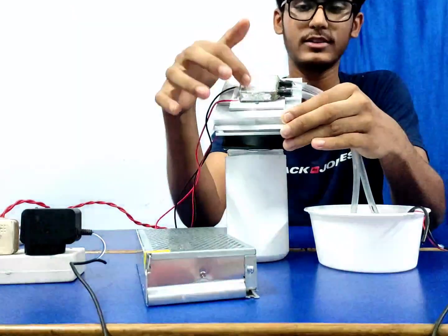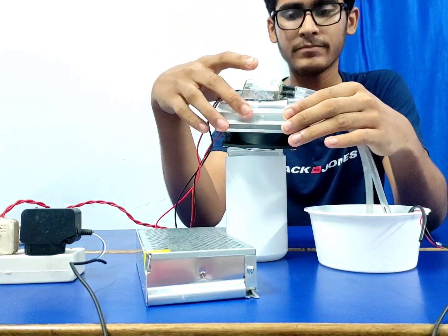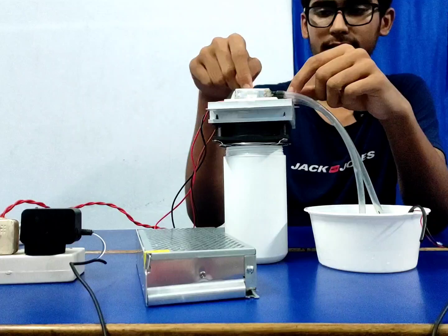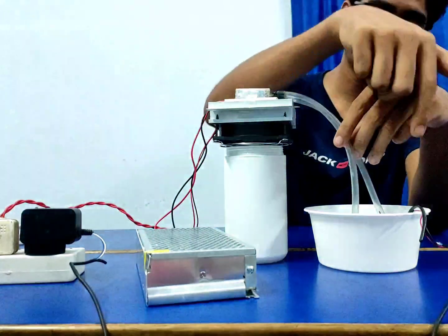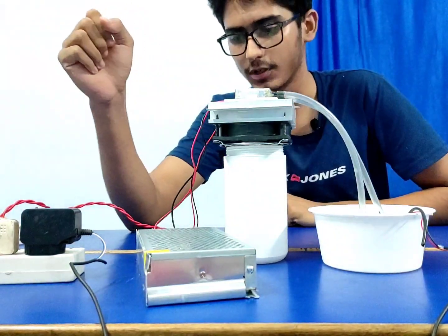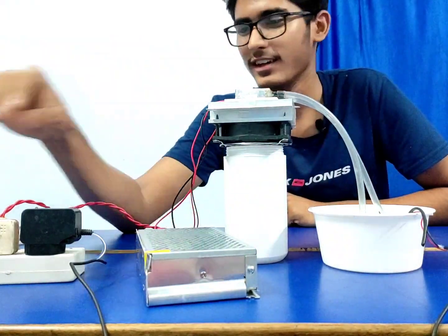This block is also known as a water block or water cooling block, or anything you can say. The main function of it is to circulate the water. The water coming through this pump will get circulated in a zigzag pattern inside, and it will come out and again go back to the water. This bucket, or anything you can call it, contains water. And the main thing, the power supply, that's a huge thing.